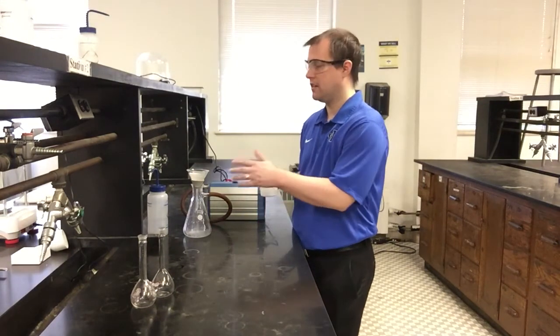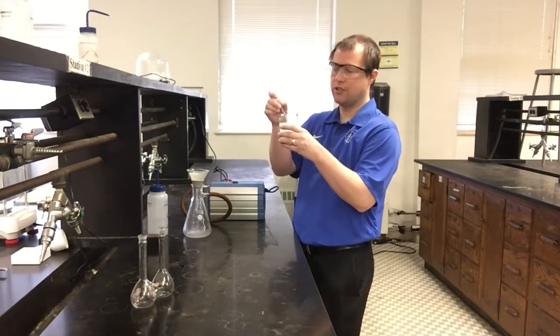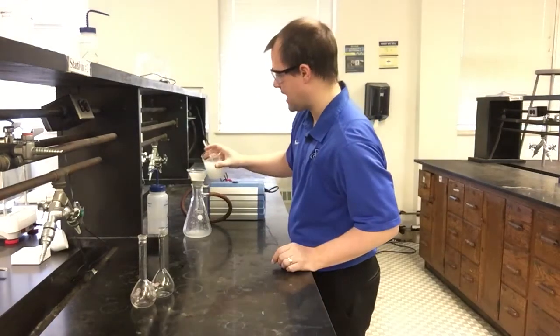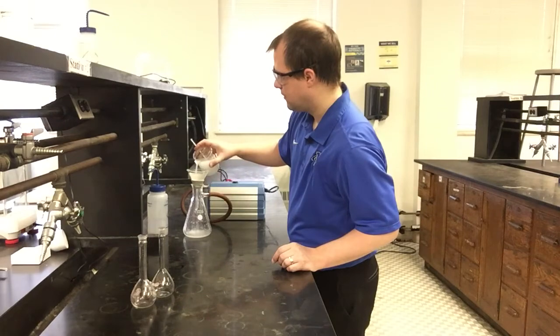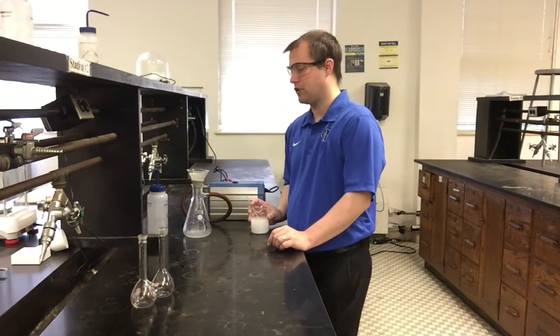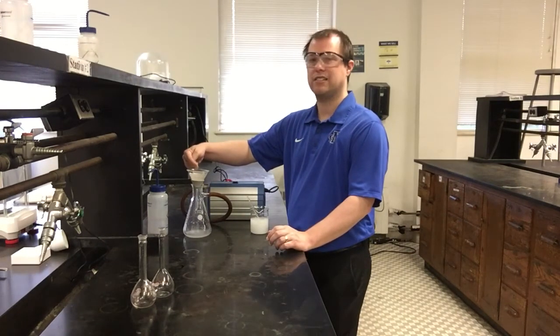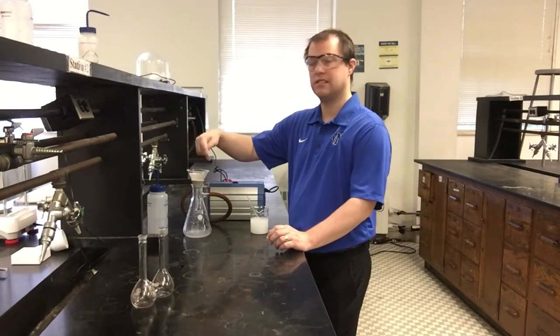It's possible that the filter paper we have isn't going to catch all of the particulate that we formed in our precipitation reaction. But we should see a good amount of solid product getting left behind on the filter paper. And as I do this, notice I'm taking care that my solution as I add it doesn't go above where my filter paper is inside the funnel.